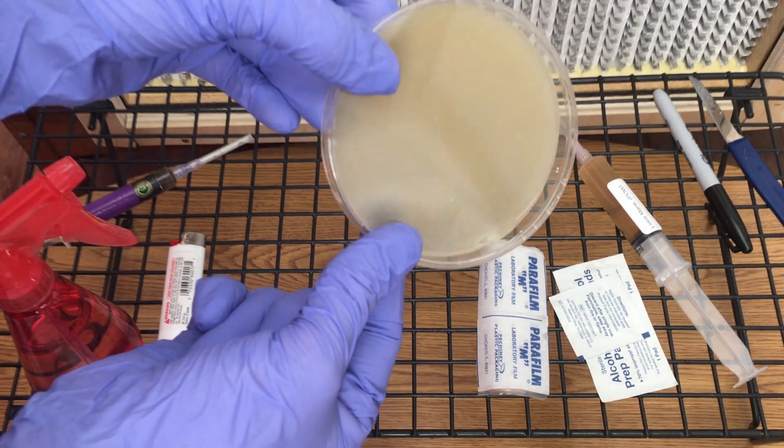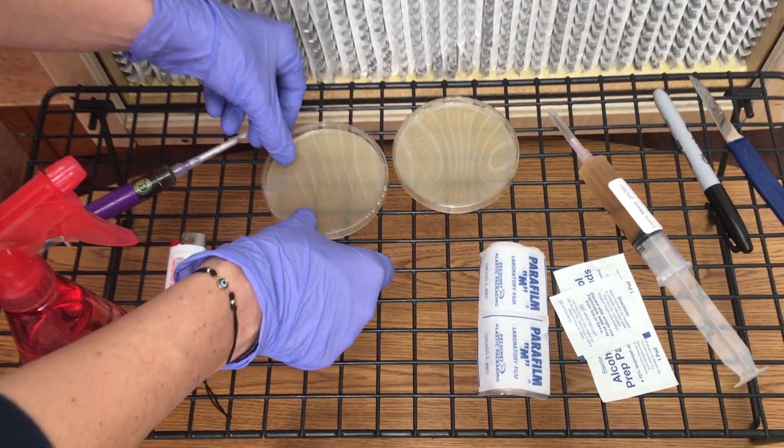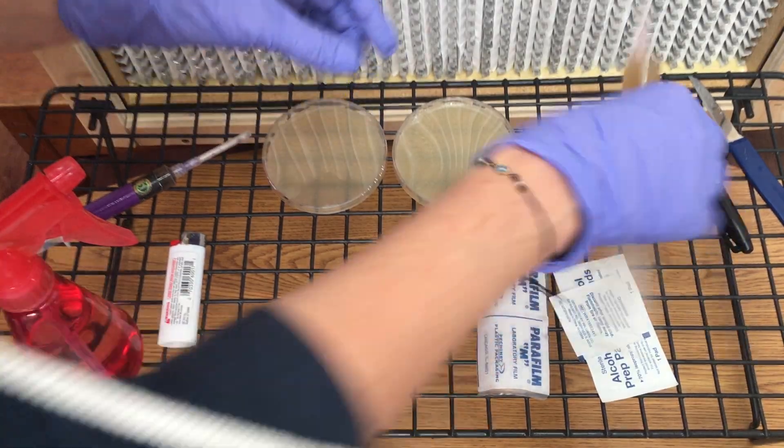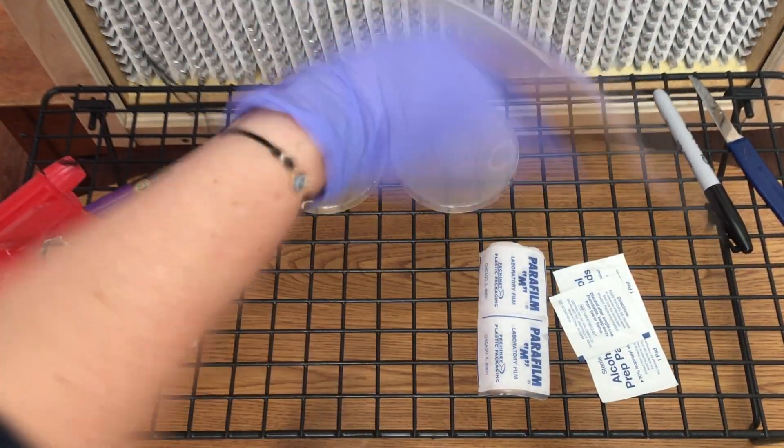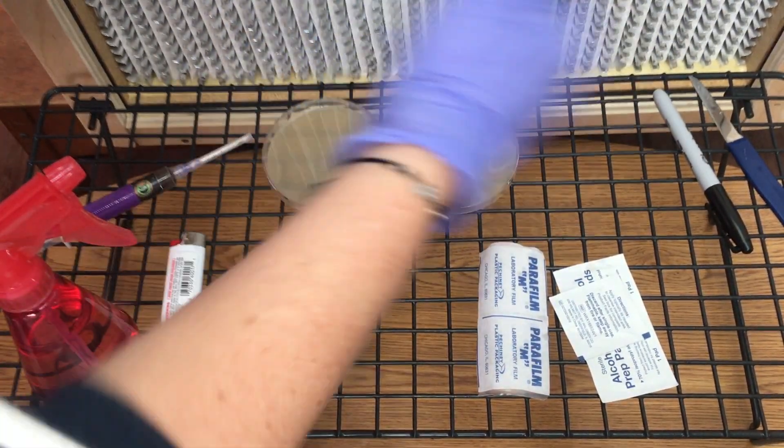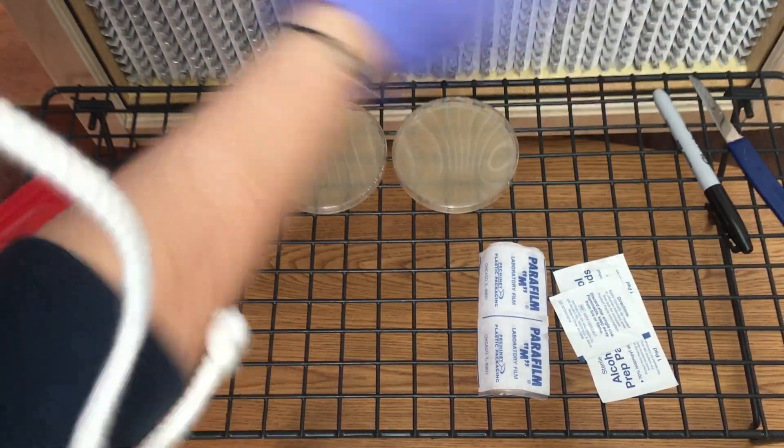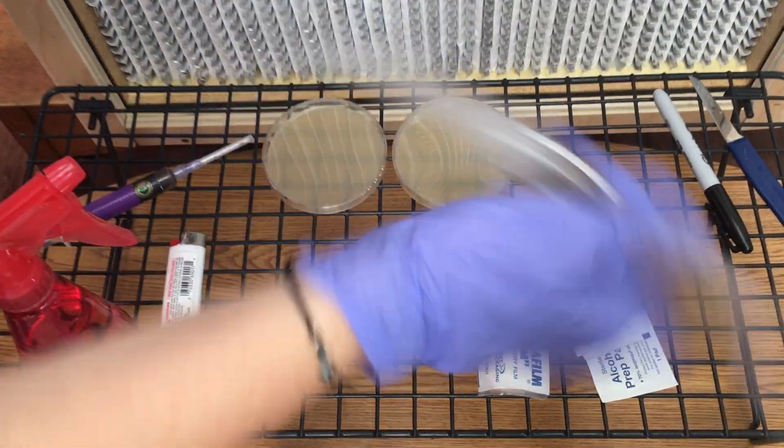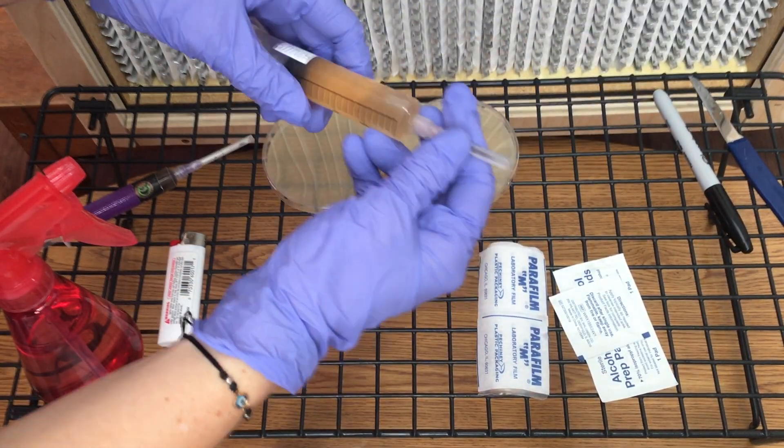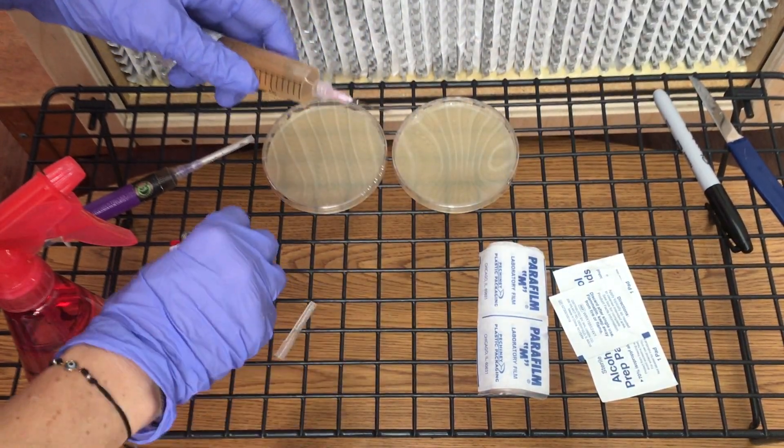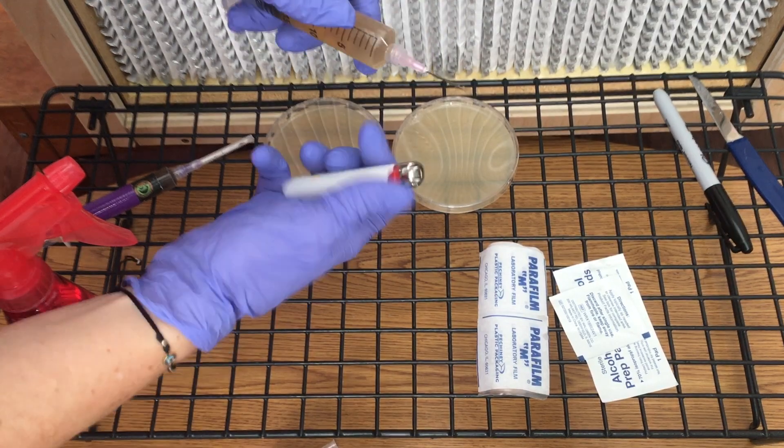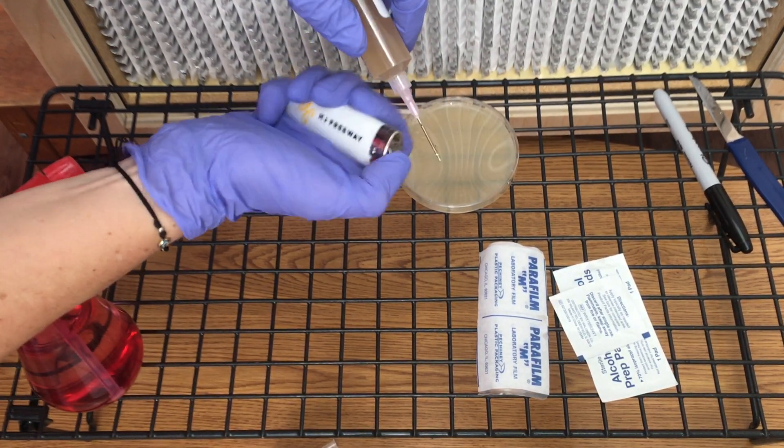And that's it, you've inoculated your agar. Then restart your process. Shake up your spore syringe, flame the needle for 30 seconds.